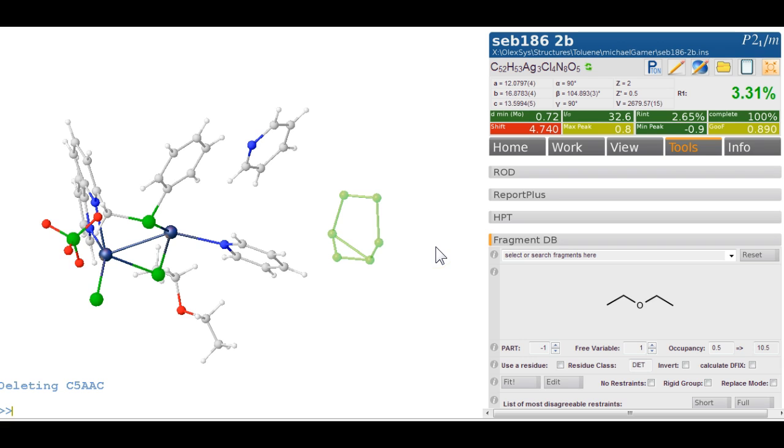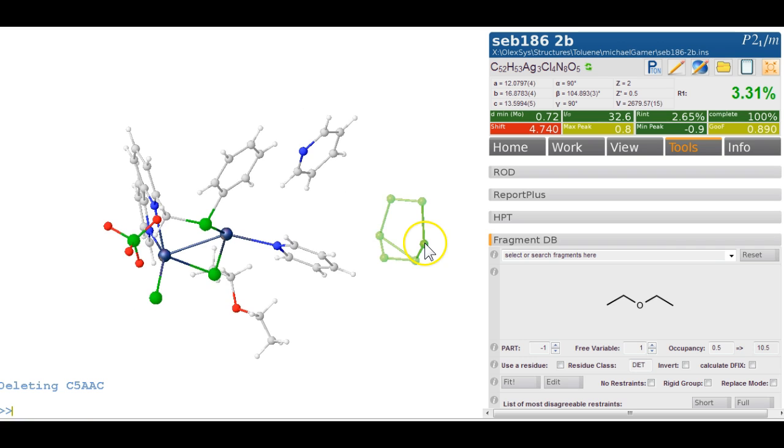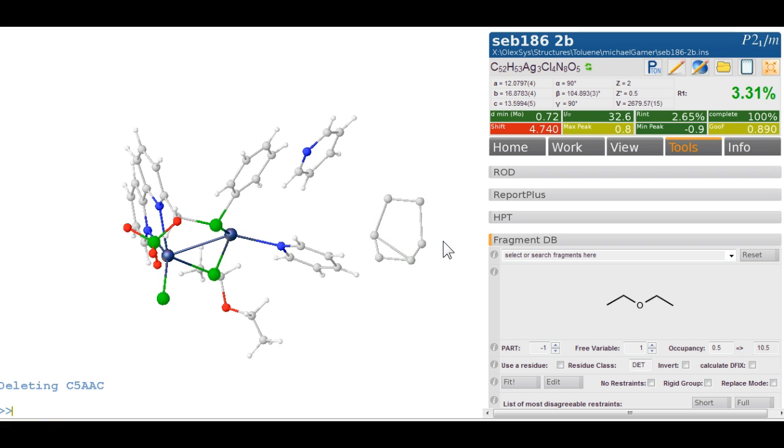And the trick here is to type PART -1 -C, and then type FUSE again. Now this has made them unique, and there is actually a doublet here. What happened is that it hasn't deleted the symmetry equivalent that we needed. So what we need is a FUSE 0.1 or something, and that gets rid of it. Now we just have to make sure that this is still in PART -1, and we want to set the occupancy to 0.5, so it's fixed. And now I suggest to put an AFIX 66 in for the time being, so it becomes a nice regular ring. Control R, and we get a nice regular ring here.